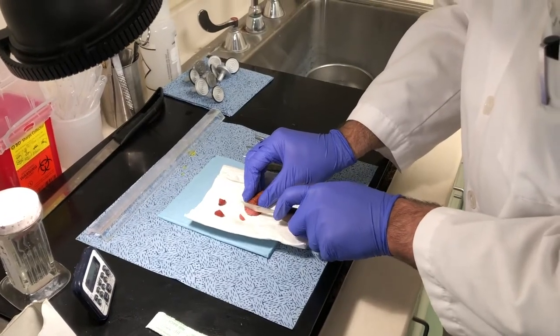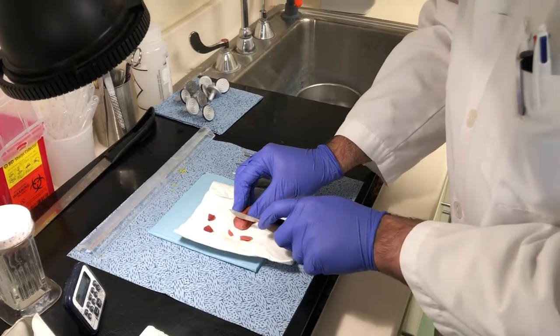Next we will be preparing the specimen by cutting it into thin slices. For this video we will be using a hot dog.